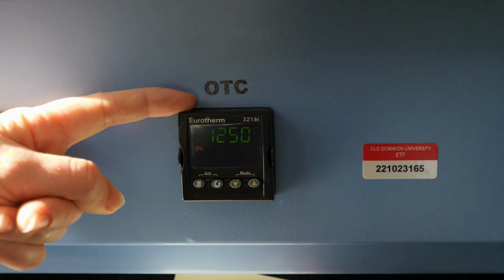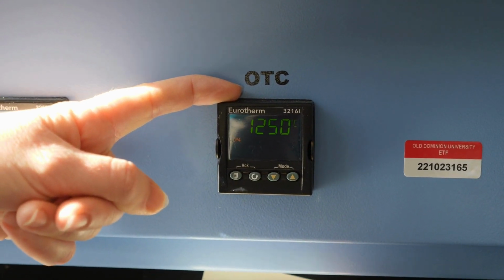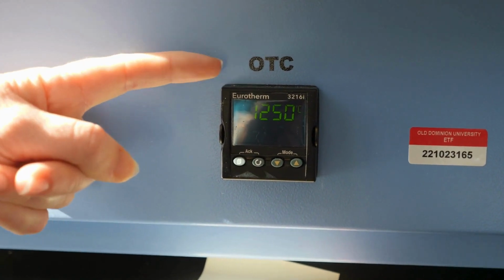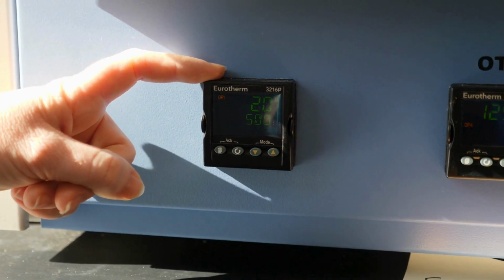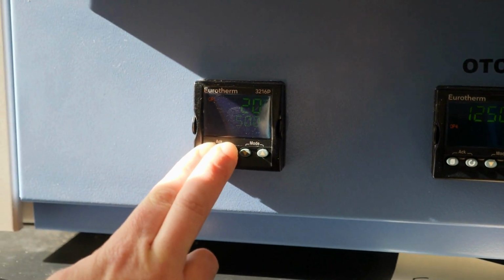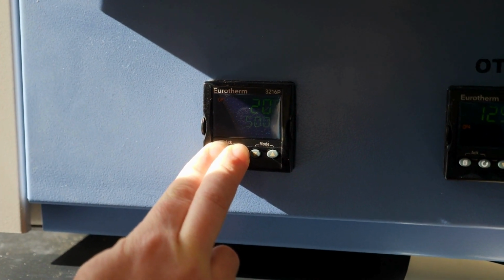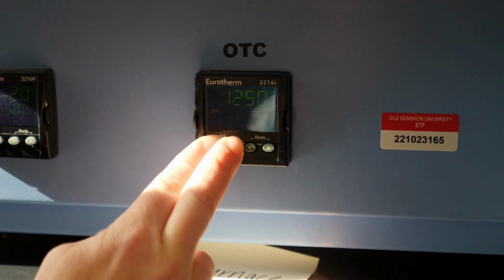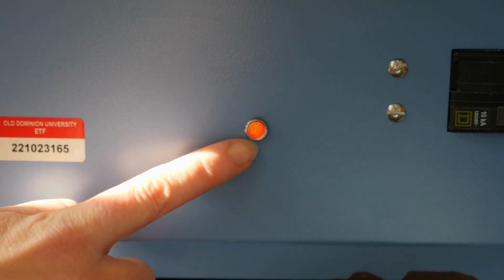The second thermometer you see here shows the override temperature. This is the temperature at which, if the oven should get on up to that degree, the oven will shut off. So once your appropriate set temperature is reached, you will turn on the machine by holding these two buttons at the same time. Oh, sorry, it's the other. There, you'll hear a click and a red light will come on.